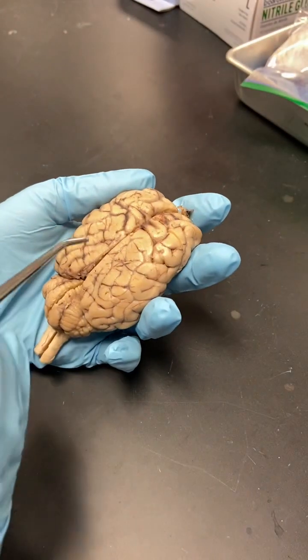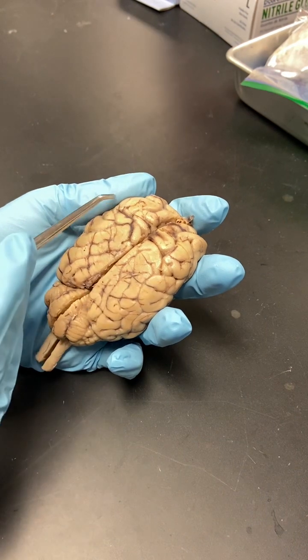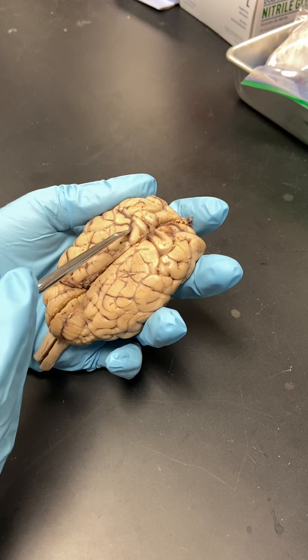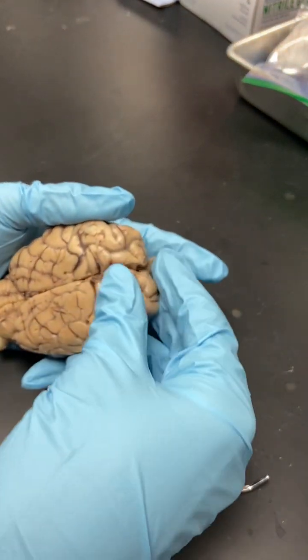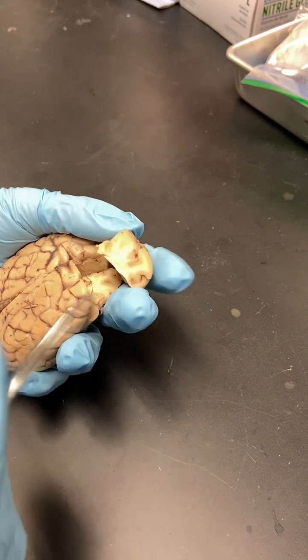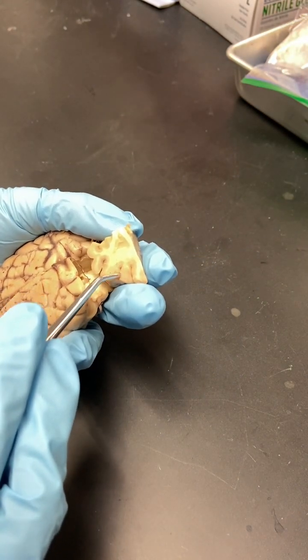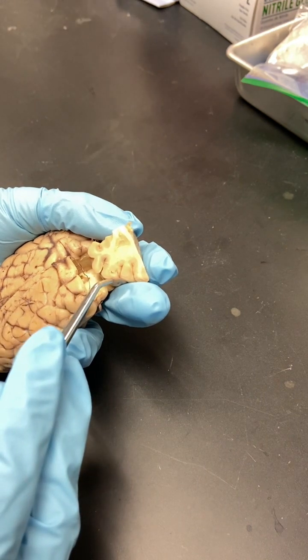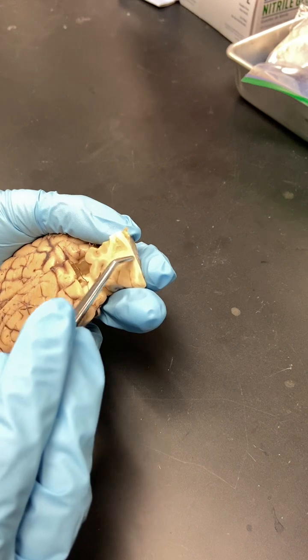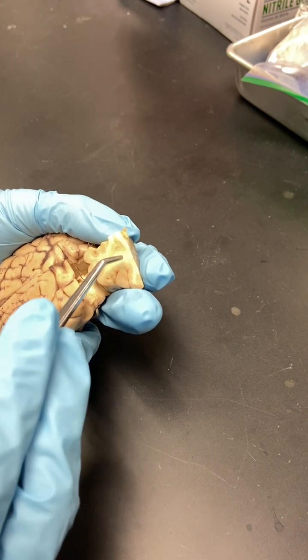All right, so looking at the external structures, you have the left and right hemisphere, you have gyri that come up, and you have sulci that go down. You can actually see on an internal cut how the sulci go down into it. So those would be sulci, and these would be gyri. This is the gray matter. You can see that it is gray, and the white matter is white because it is the myelin around the axon.